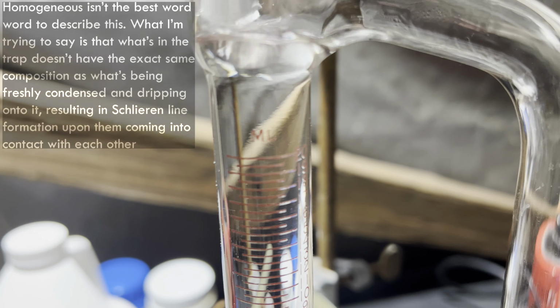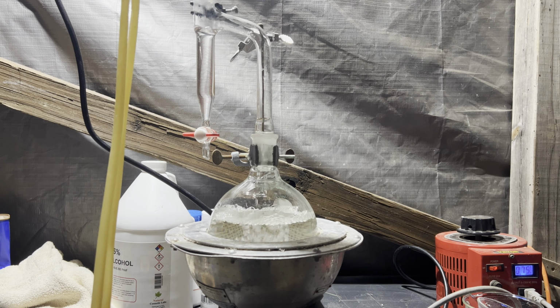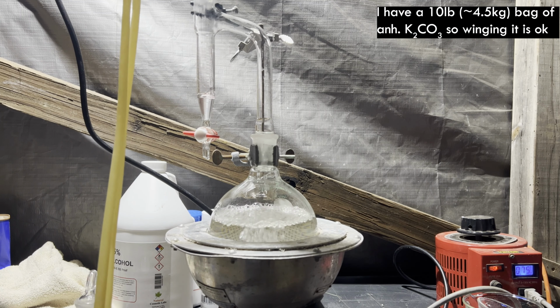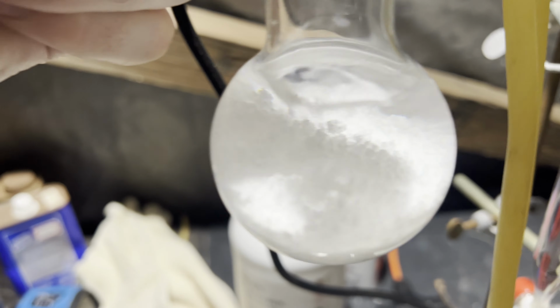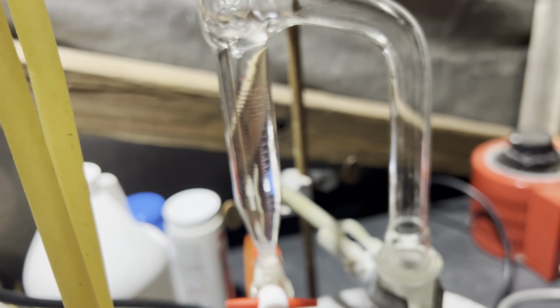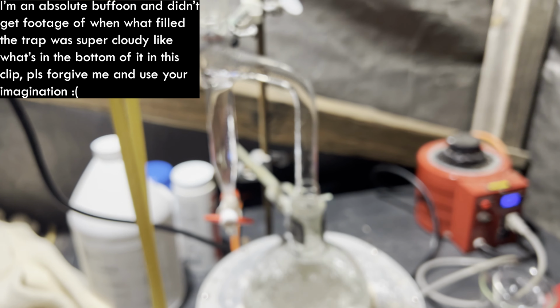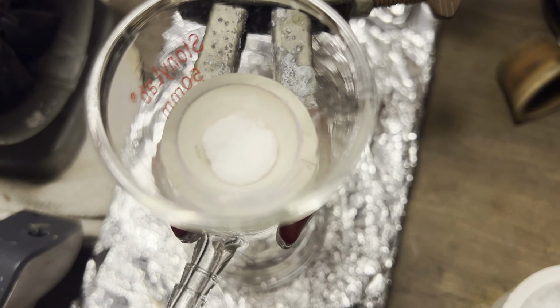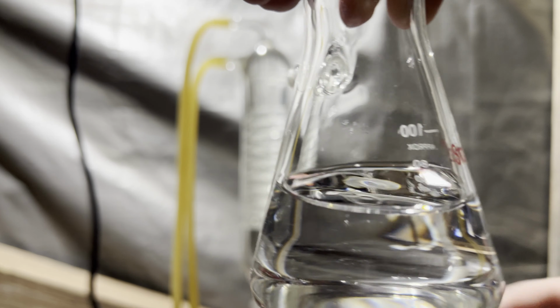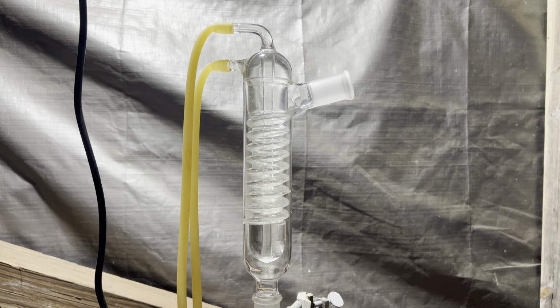And then here's the 100 milliliter RBF with potassium carbonate. I didn't measure this out, I'm just going to be winging it. You know the potassium carbonate is absorbing water when it clumps together, and when it stops clumping together, it's no longer absorbing water, or it no longer has any water to absorb. Afterwards, I'm just adding it back in through the condenser, right here, with a very big pipette.